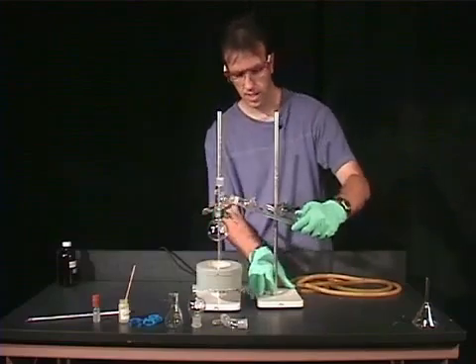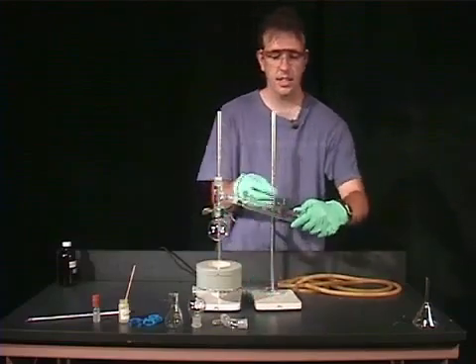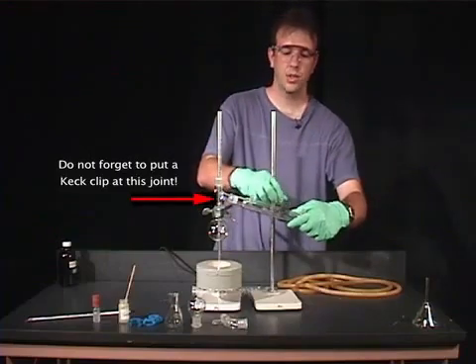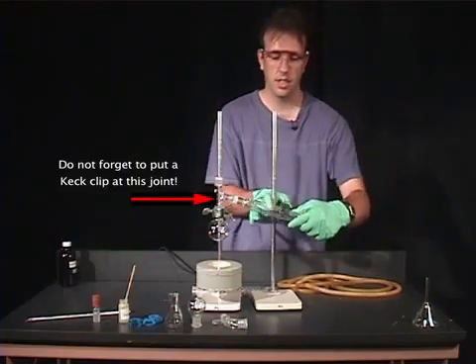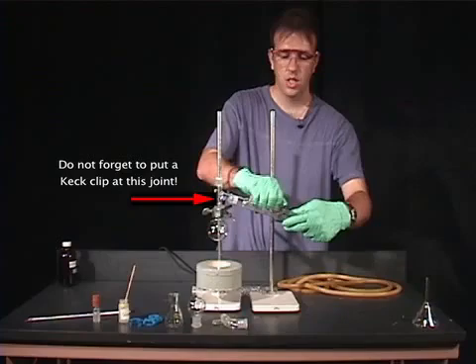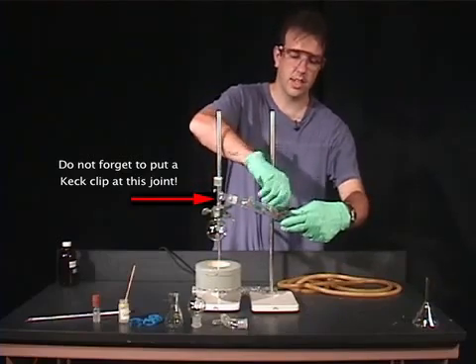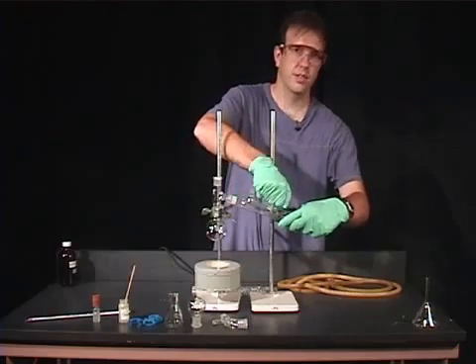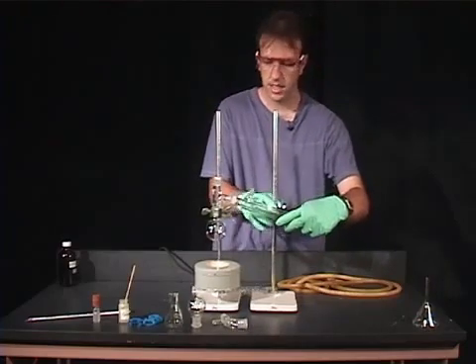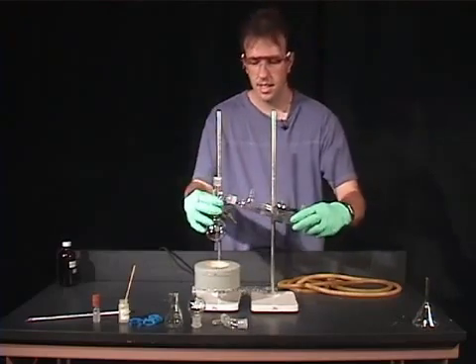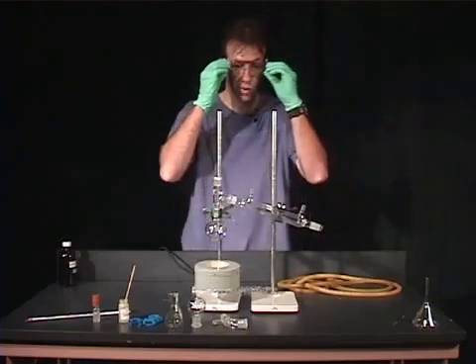We add this in here. Now this clamp is used mainly for stabilization. You don't want this to be very tight. You don't want to clamp this down all the way. This is just there to provide a little bit of support. So I got that in there. It's not too tight. But now the glassware's not going to move.